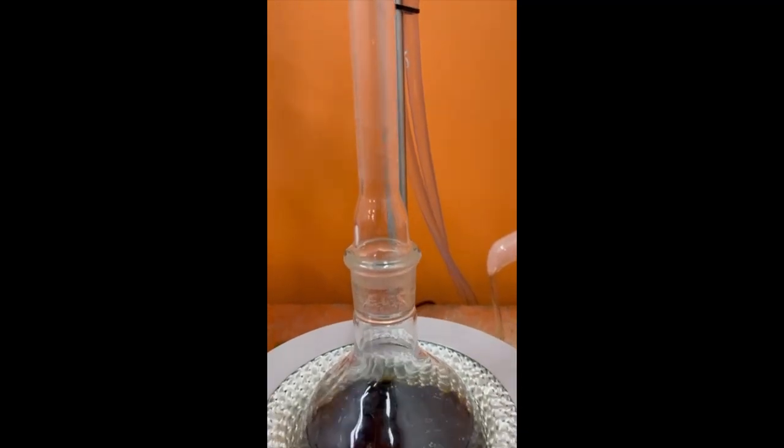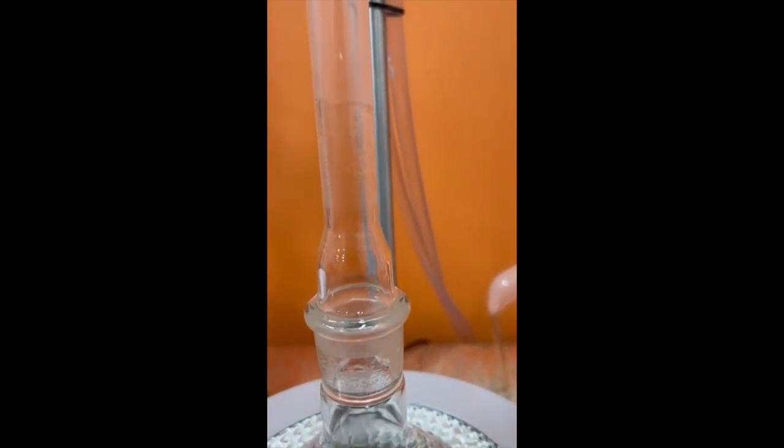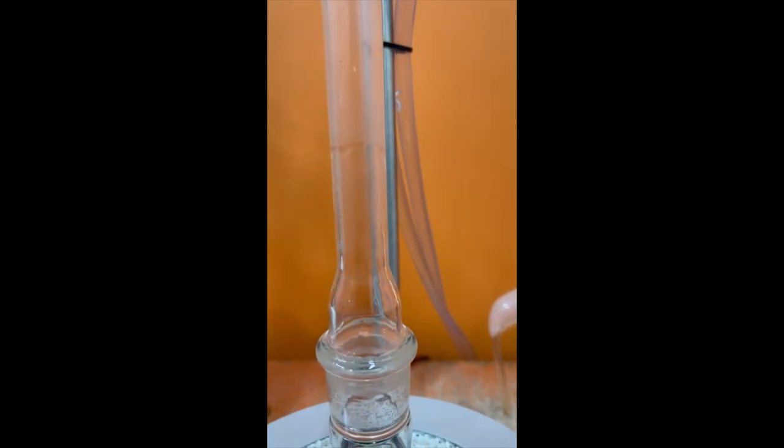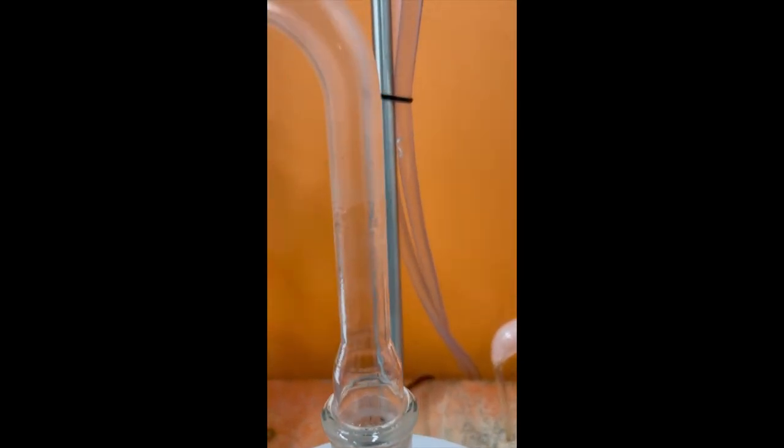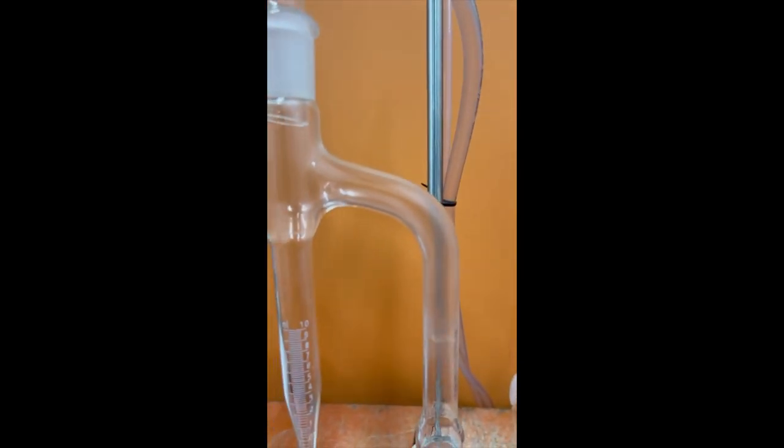And now we can see here starts the evaporation.